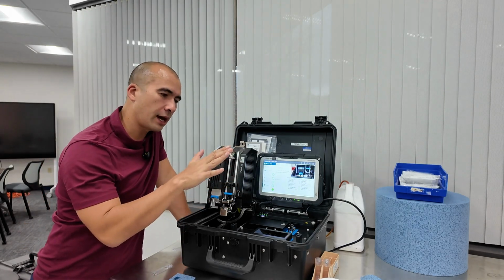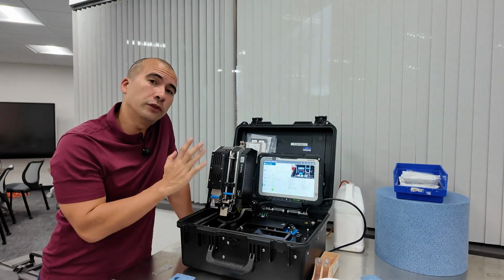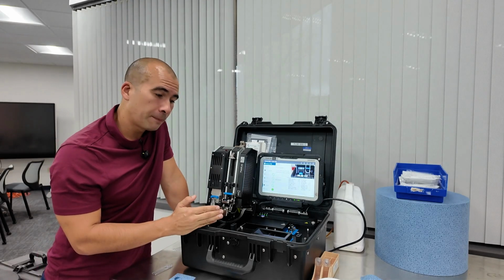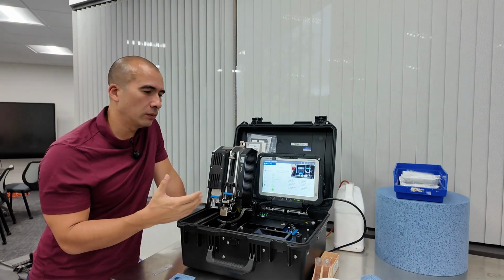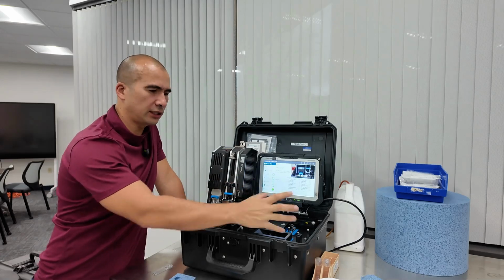So this is the FieldLab 58. Super useful for certain applications. And I think gas and steam turbines, so anywhere where you've got tilting pad bearings, engine analysis as well, where you're trying to identify, are the wear metals aluminium, are they iron, are they copper, tin, all of that sort of stuff.